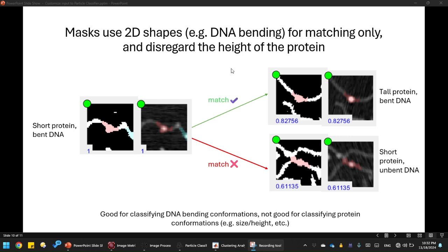This is what I'm talking about by using particle masks as input to the particle classifier. The benefit of using masks is that it only uses 2D shapes such as DNA bending for matching, and disregards the height of the protein. So in this example, this is a short protein but with bent DNA, and it matches well with a tall protein with bent DNA. So the height of the protein doesn't matter. The DNA bend state matters. And it does not match with the short protein with the unbent DNA. So even though they are the same height of the protein, the DNA bend state is different, so that's why they do not match. So using masks as input to particle classification is good for classifying DNA bending conformations, but not so good for classifying protein conformations.